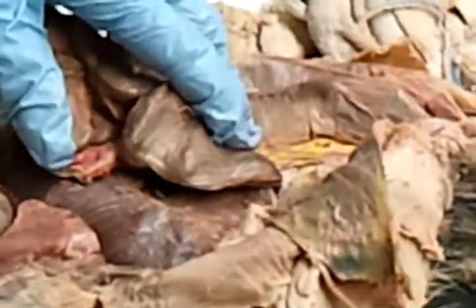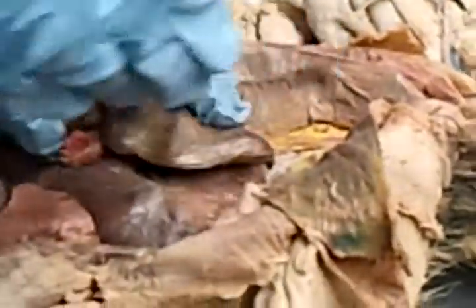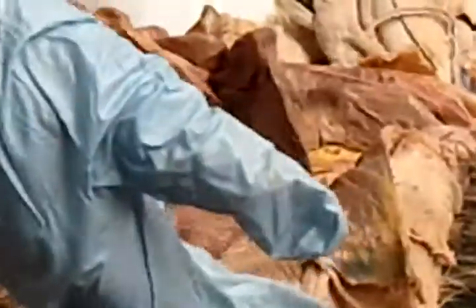And our goal Wednesday, folks, is to follow the aorta down and look at all its branches. And yes, we'll have to disturb all this stuff, but we need to keep all this stuff we're just going to go through intact for when we get to the digestive system. So that's why we want to do a quick appreciation of this first. So if you all go back to your seats, does everybody have 3 different colors of writing implement?